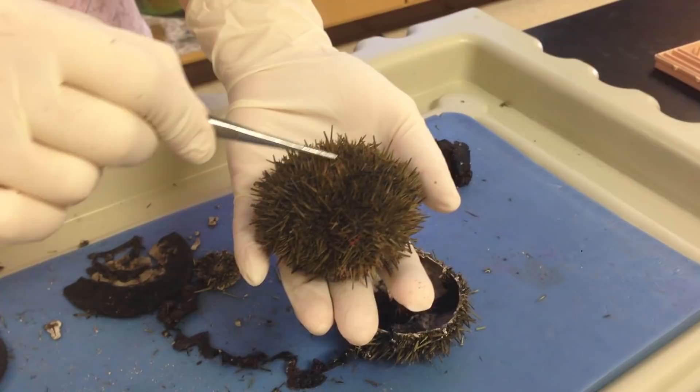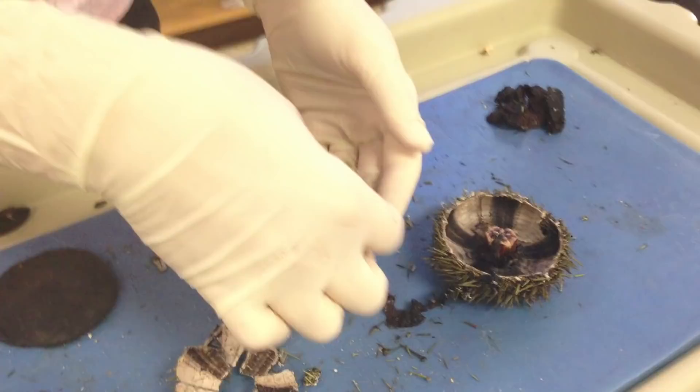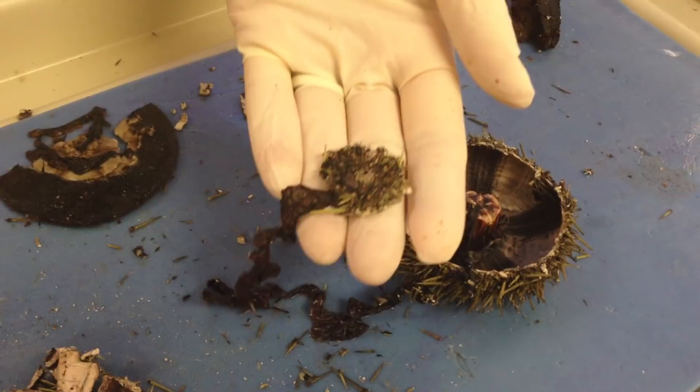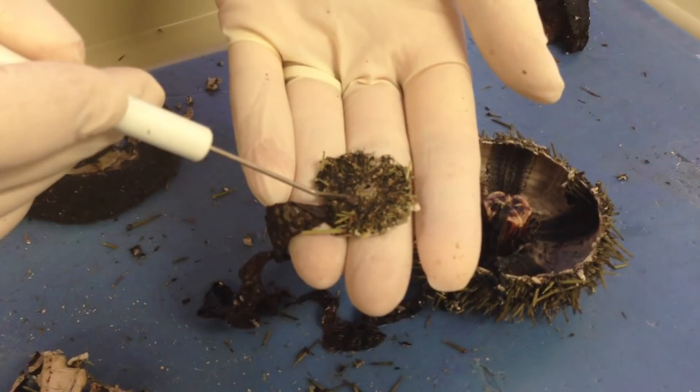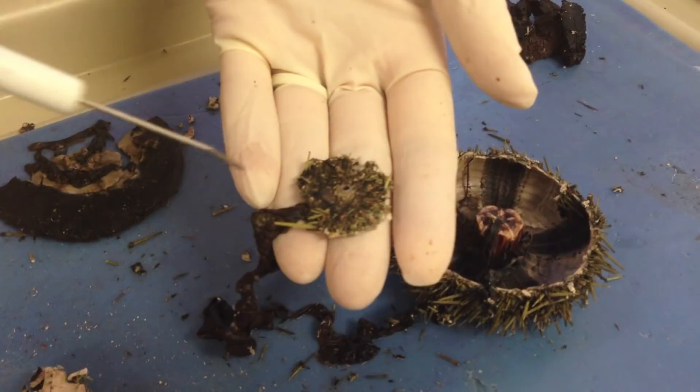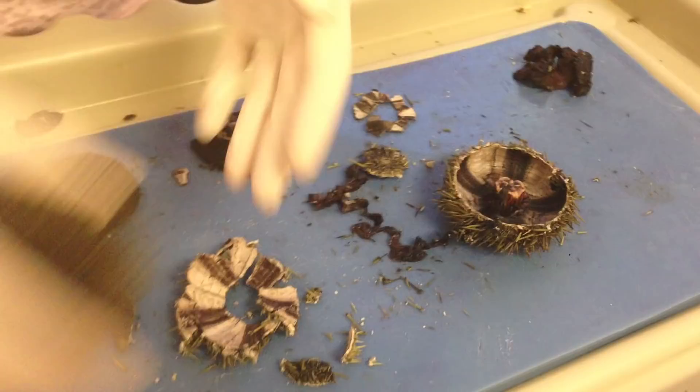The anus empties out here, and then there are all these plates. If you observe here, you can see that this darker large region is going to be the madreporite, and then the center region is the anus, and this region right here is the periproct, and these would be the genital plates. On each genital plate, you're going to find a gonopore, which is a hole in which the gametes will be released when it's time to spawn.